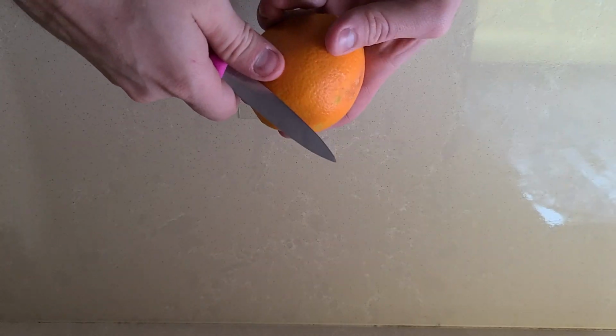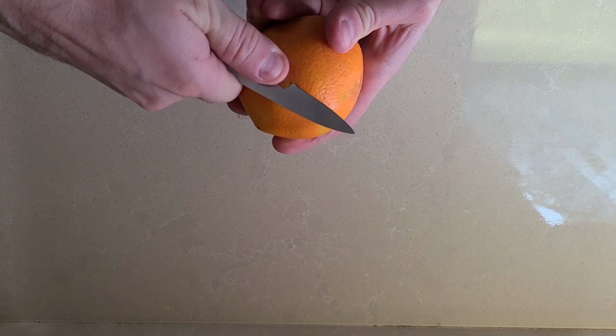Hi, today we're going to be comparing the surface of an orange to the surface of a tangerine. And as always, we begin by preparing our slide.